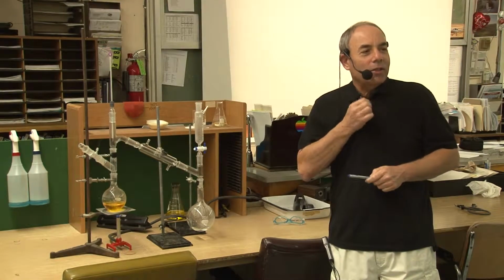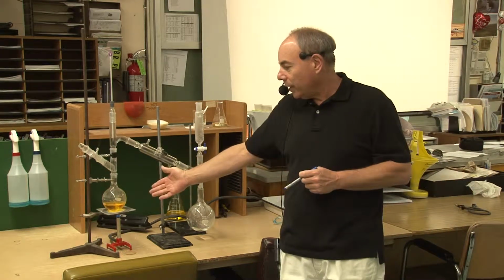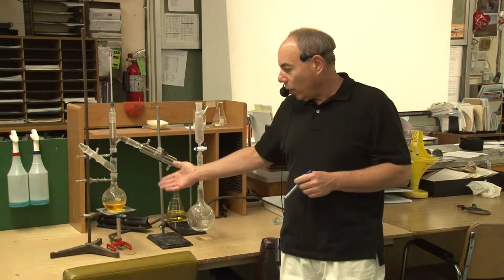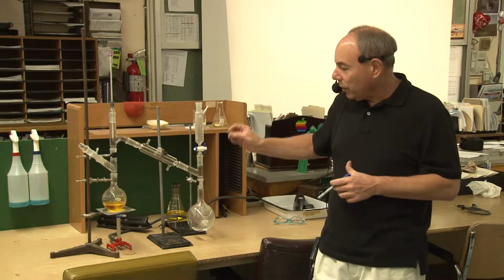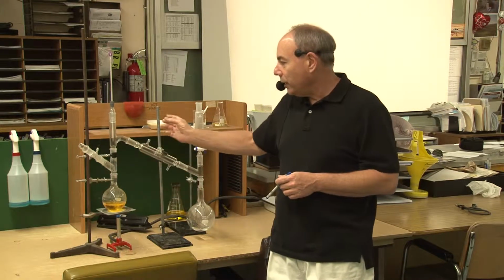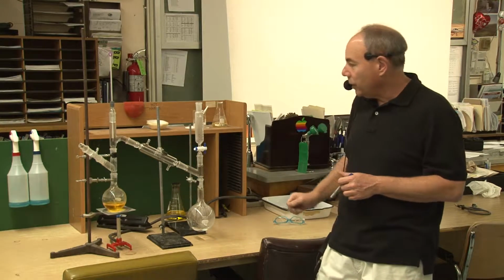Okay, the question is that if you had several liquids mixed together, what would happen? Let's say we had 3 liquids mixed together and we needed to separate the liquids. One boils at 39 Celsius, one boils at 68 Celsius, and the other is water boiling at 100 Celsius. If I started heating this up, the first lowest boiling point liquid would start to boil, and that would vaporize out, coming out over here and going into the receiving flask.